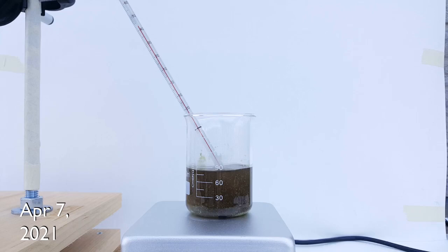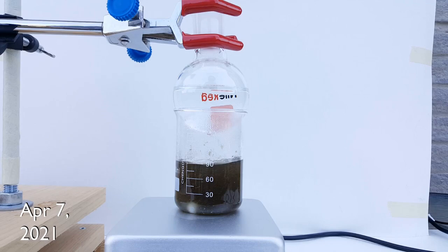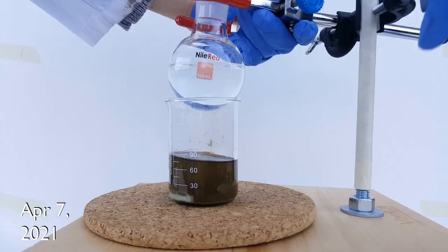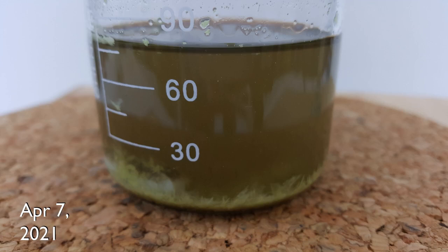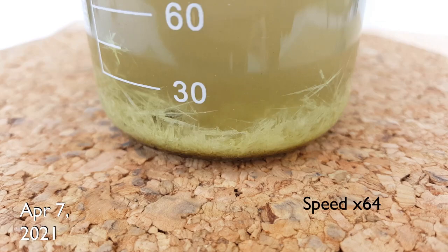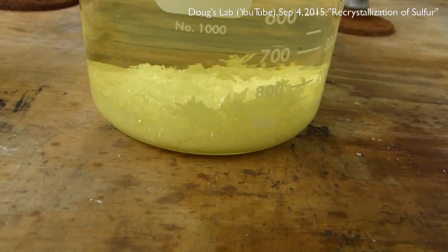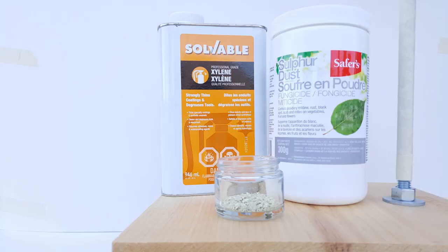Over the course of 30 minutes, the heating is gradually increased to between 65 and 70°C and six more scoopula-fulls of sulfur dust are added — between 3 to 6 grams — bringing the total between 4.5 to 9 grams. At each addition the solution became more and more dark and cloudy until it was like a really disgusting black coffee, with some light-colored solids still floating around — undissolved sulfur dust — meaning I had a saturated solution. After being held at temperature for 10 more minutes, the heating and stirring were turned off. The beaker was removed by hand, cleaned of oil, and placed on a cork mat to slowly cool. In less than a minute, I observed bright yellow spears of elemental sulfur begin to crystallize out of solution. The formation of bright yellow crystals is consistent with previous demonstrations of the recrystallization of sulfur, so it seems like we've reproduced the previous results successfully.